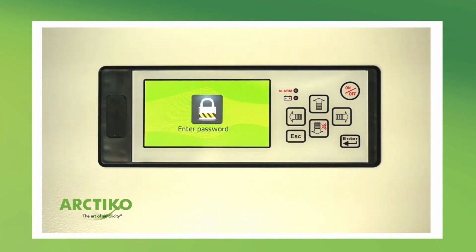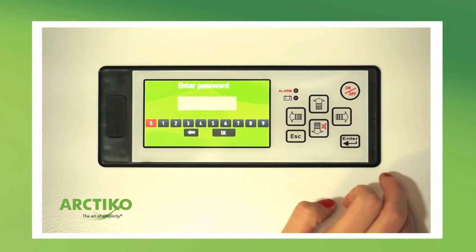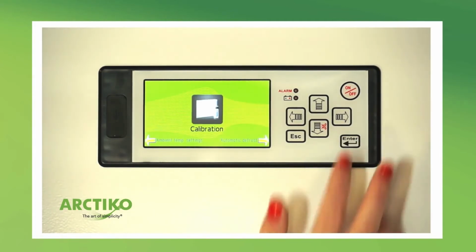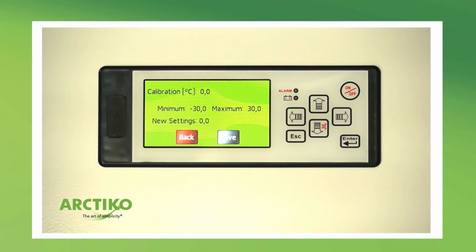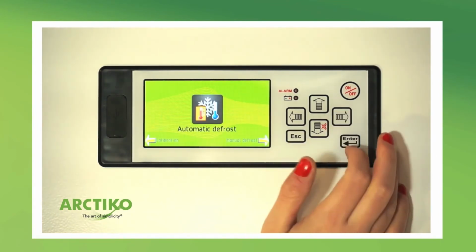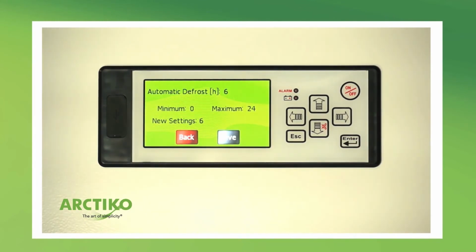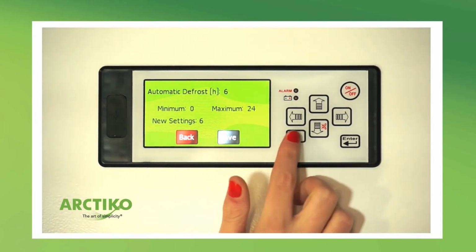Advanced settings is protected with a password. Access with the password 0000. In calibration, set the offset of the temperature in the display. In automatic defrost, set the time when an automatic defrost should be performed.